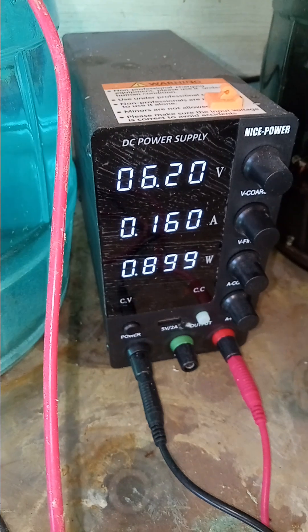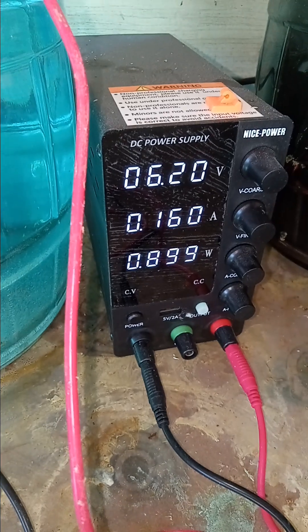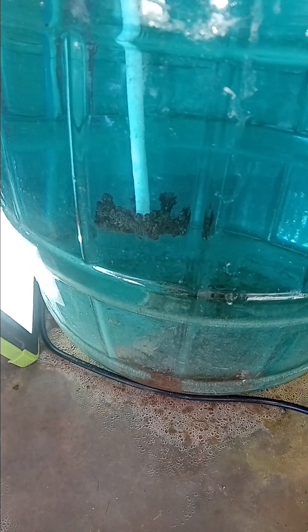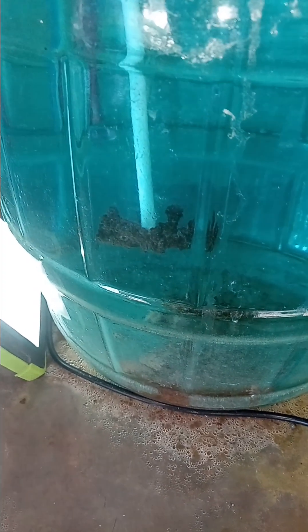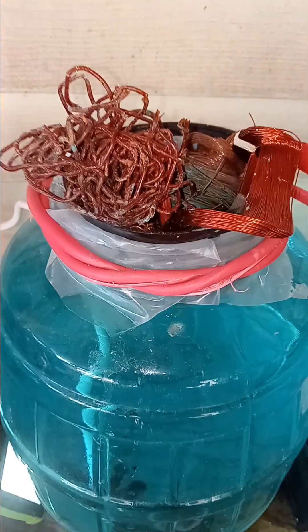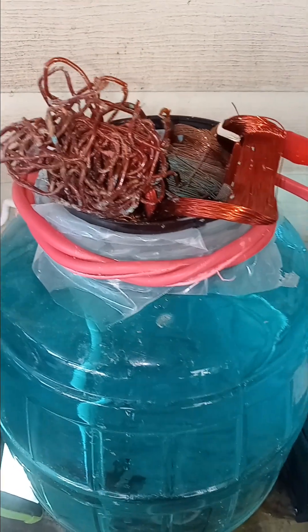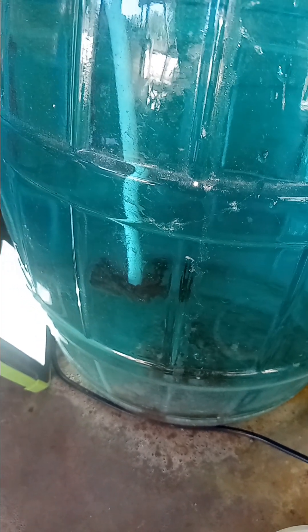The parameters changed just a little bit. I'm going to let this run for a few more days and then come back and give you another video showing the progression of this crystal. Remember, this is a 99.99% fine copper crystal that we're growing using just random scrap wire from my pile. We made the electrolyte using Epsom salt, copper, and electricity — nothing else.